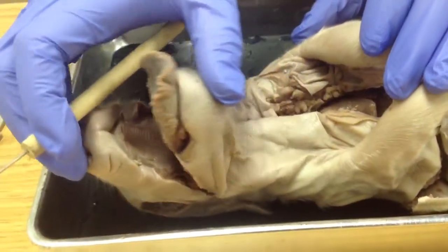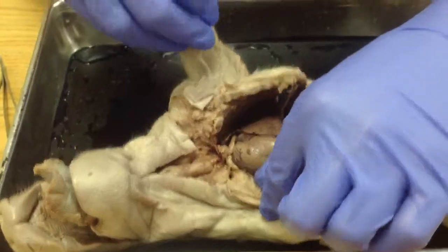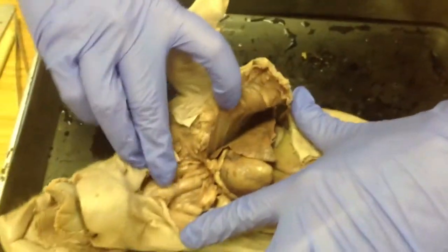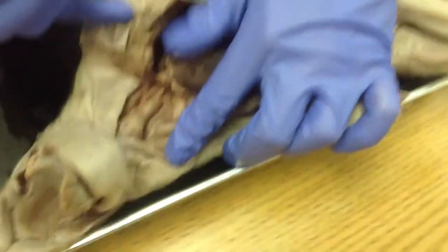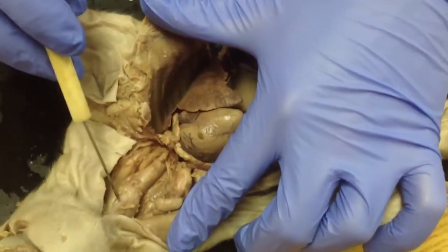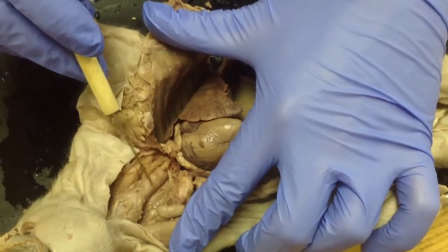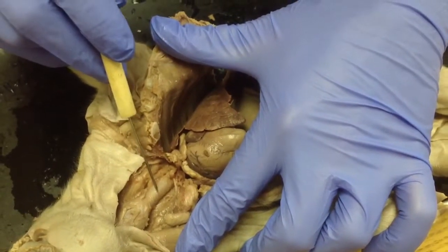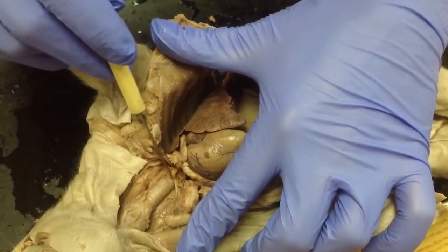Let's come down, and we're just going to work our way down through the pig. So let's open up the thoracic cavity. And that's the whole chest cavity here. First thing we have as we're moving down through this, hold these arms out of the way. This big lump right here, that is the larynx. That's the voice box, so the vocal cords are in there. From the larynx, air moves down through this lovely structure right here, and that's the trachea. You can see those little cartilage rings that keep it open so they can breathe all the time.